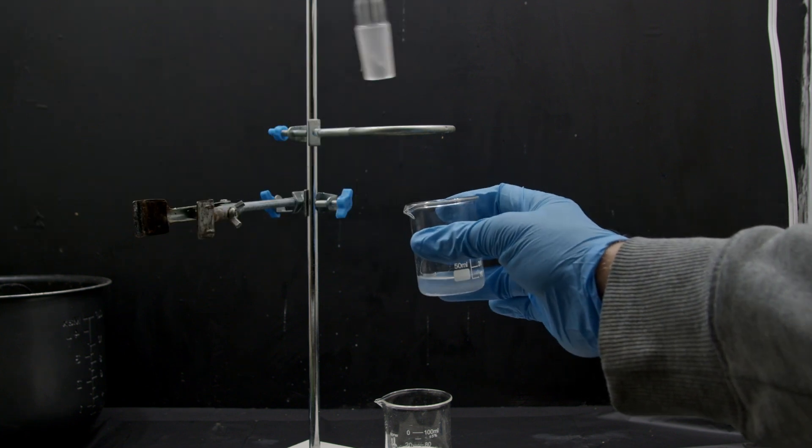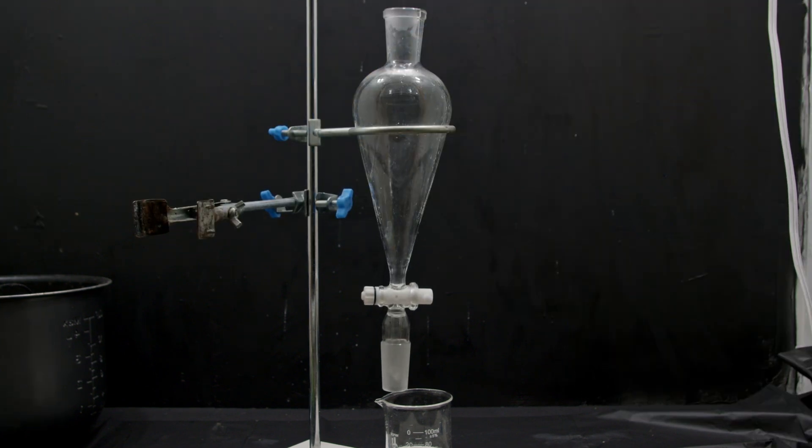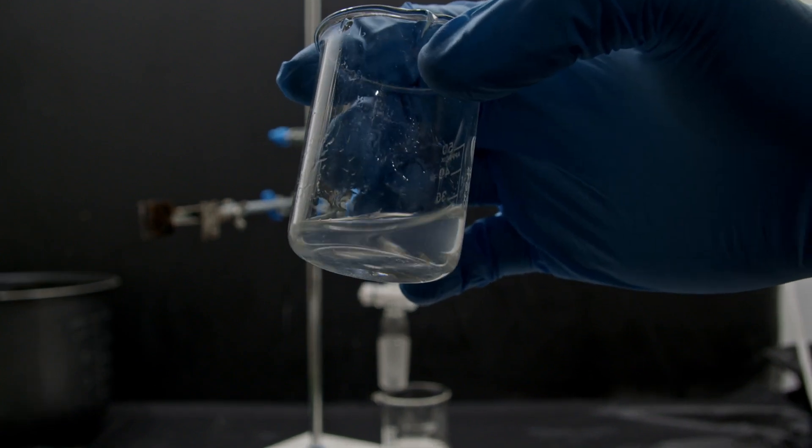We then pour off our final product, and there we have it. Propyl ethanoate. Artificial pear smell.